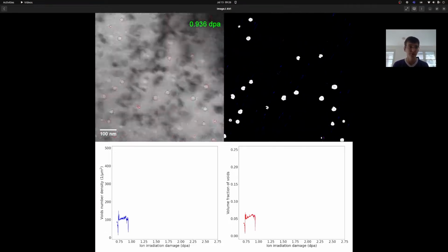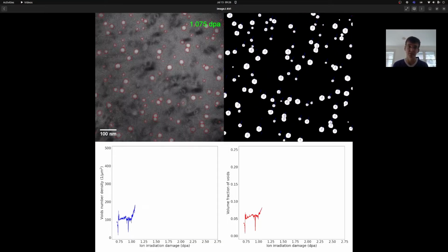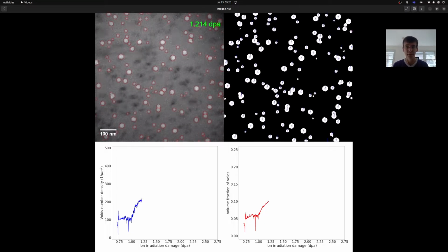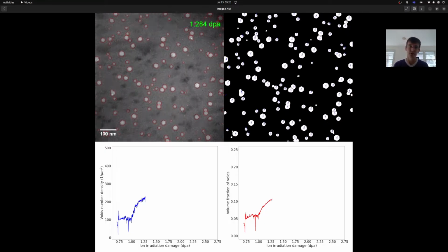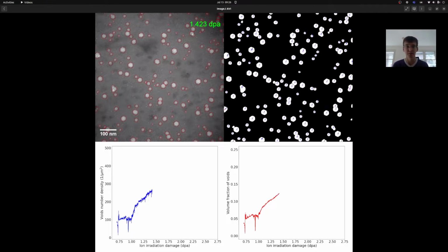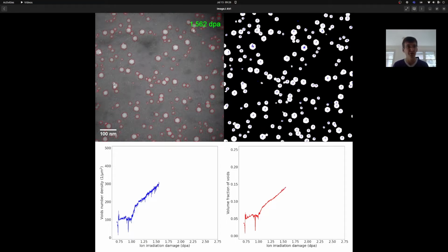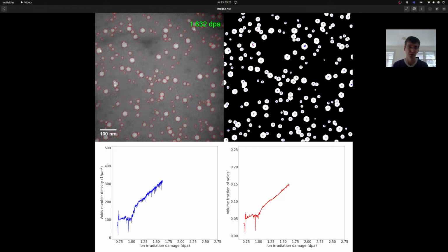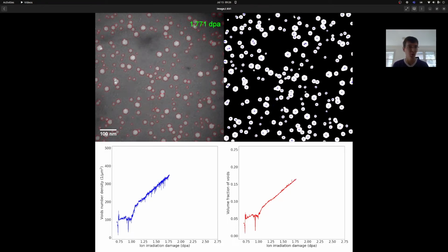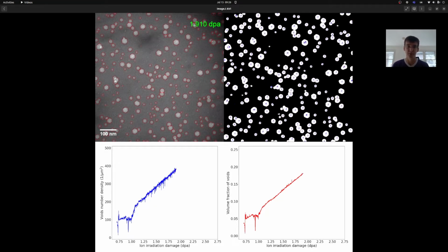What's happening here on the material science level is we're irradiating a sample inside of a transmission electron microscope. So what you're seeing are little voids forming as a result of the radiation destroying the structure at the atomic scale. If you look at the scale bar, that's 100 nanometers across. An atom is roughly a quarter nanometer in size, so each of those voids is maybe 40 to 80 atoms across, which is mind-blowing, but not the point of the lecture today.